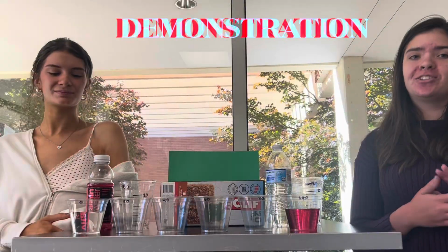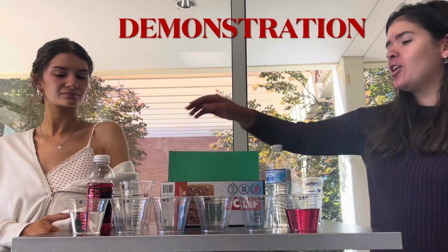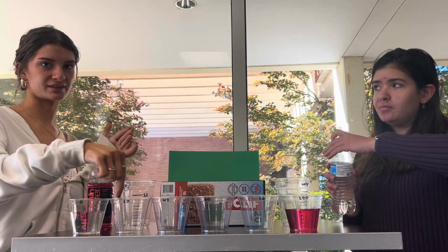We already have the stock solutions prepared, so this is our blank right here. It's just water, and then we have 100% of the vitamin water right here. And then we're also going to be showing you guys how to prepare all of these solutions in the middle. So just for time's sake, we're just going to be showing this one. But to make this solution, I'm going to be pouring vitamin water to the first tick line, and then she's going to be pouring water to the fourth tick line. So that'll create a 4-to-1 ratio for this one.